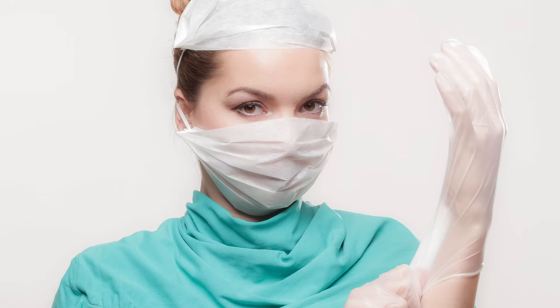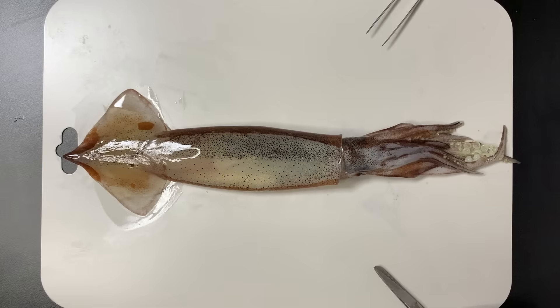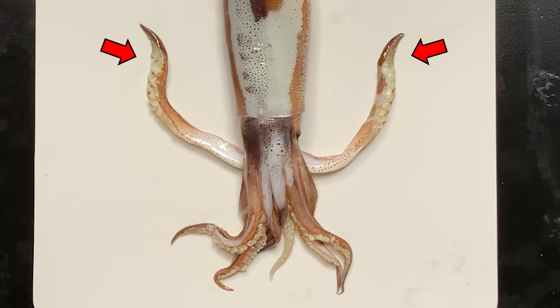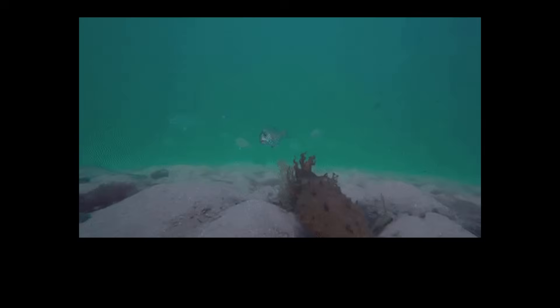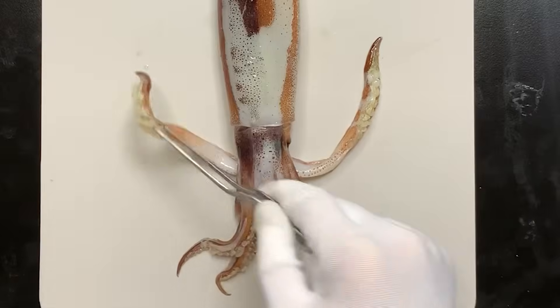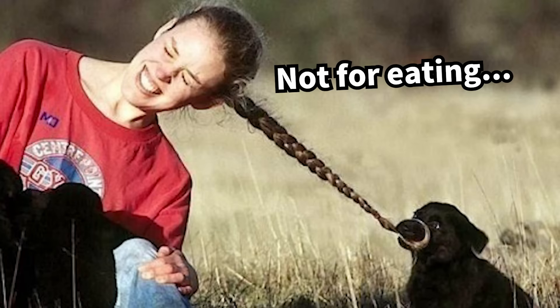Let's start the dissection. We asked the store to paralyze the squid's nerves before bringing it home. Before dissection, we observed two special limbs. Squid have eight arms and two long tentacles used to grab prey. The tentacles are longer than the arms, and their suckers are shaped like saw teeth to keep prey from escaping. That's why people sometimes remove the tentacles when eating squid.